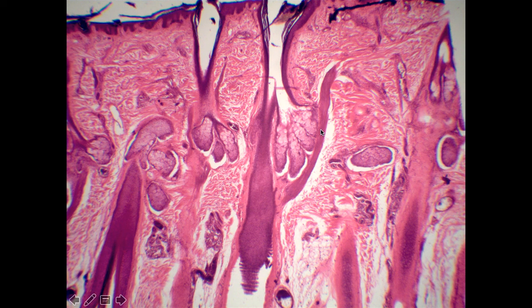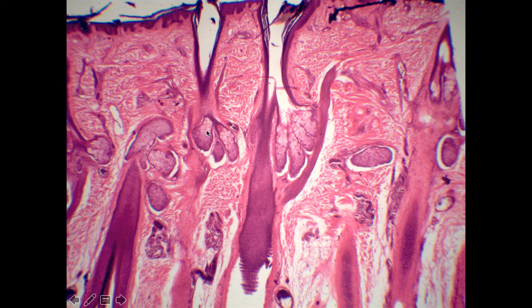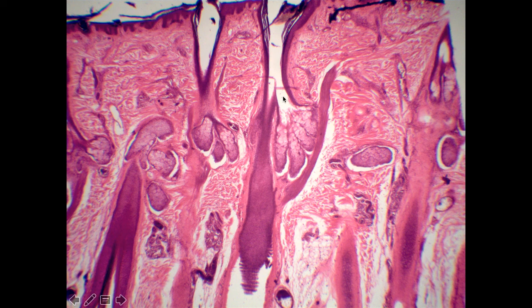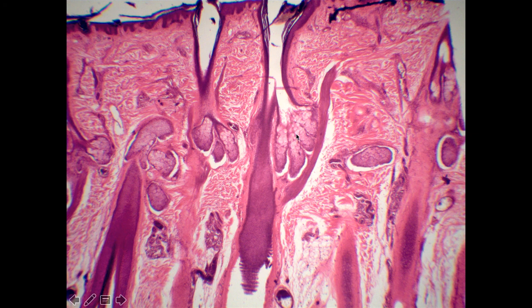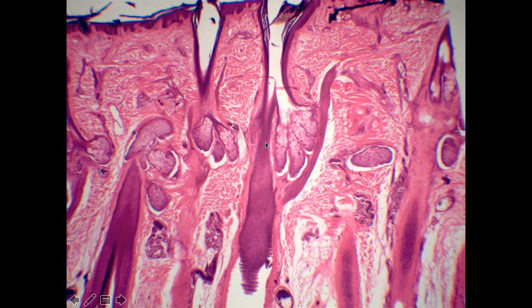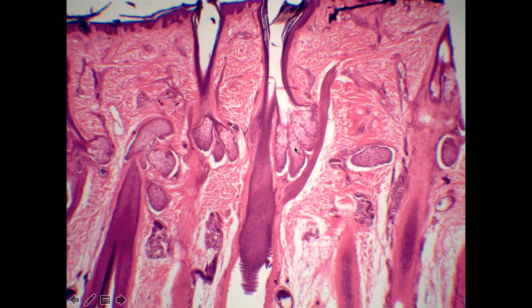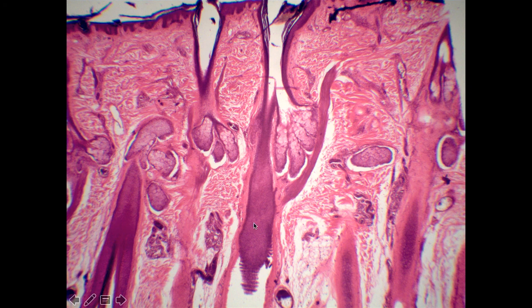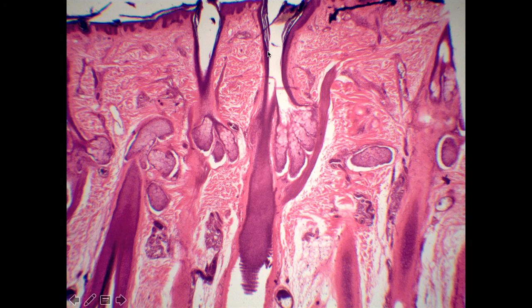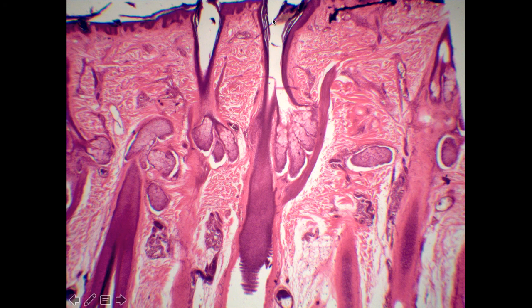In the final slide, the prominent structures are these big, fluffy, almost foamy-looking cells that all drain into a big open space. These are another type of gland — the sebaceous glands, the oil-producing glands we learned about in lecture. Sebaceous glands use the holocrine secretion method, where the whole cell ruptures, and they secrete into hair follicles. The hair follicle is the dip in the tissue; the root of the hair is the part below the surface, and the shaft is the part above the surface. Sebaceous glands help lubricate and moisten the hair follicles.